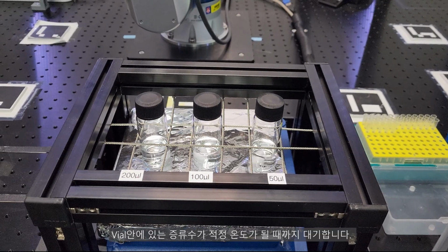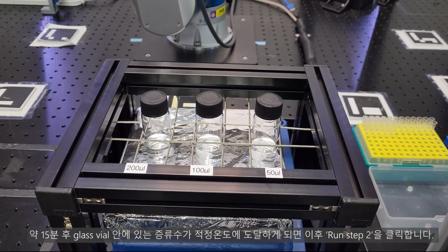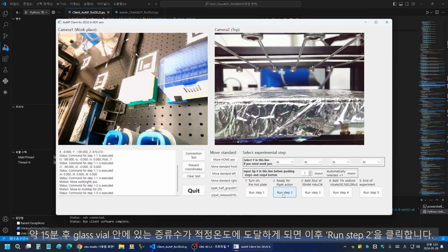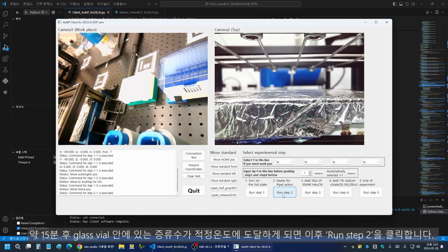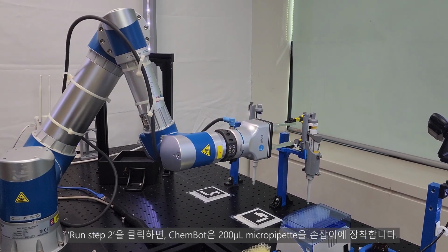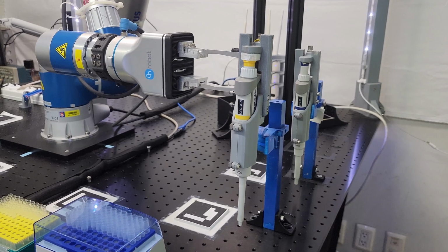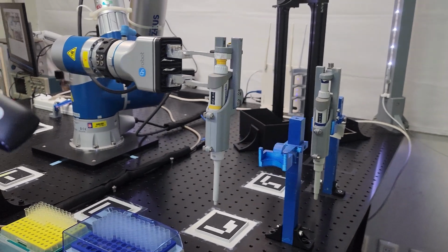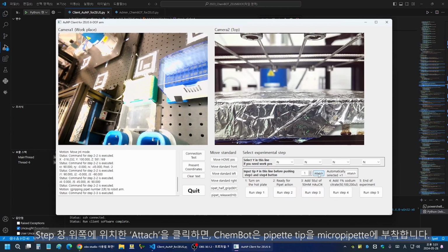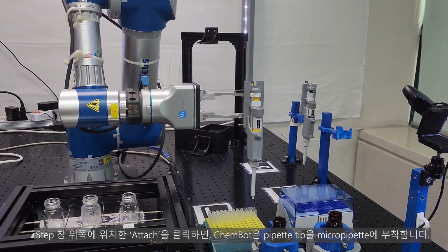Wait until the distilled water in the vials reaches the appropriate temperature. After approximately 15 minutes, when the distilled water in the glass vials reaches the appropriate temperature, click Run Step 2. ChemBot will attach the 200 microliter micropipette to its gripper. Click Attach located at the top of the step window, and ChemBot will attach a pipette tip to the micropipette.